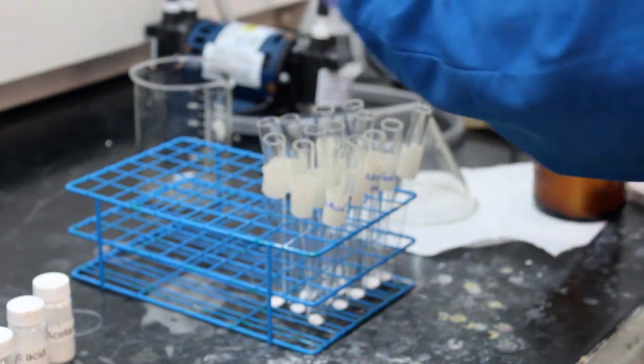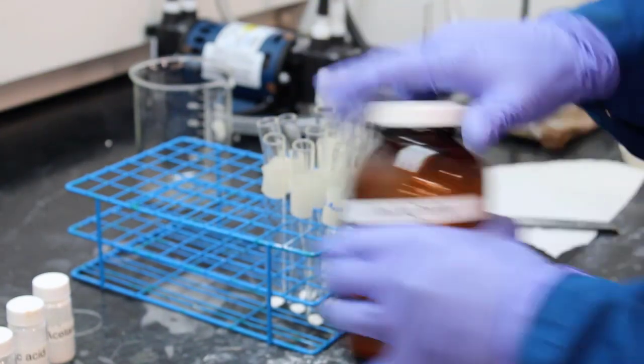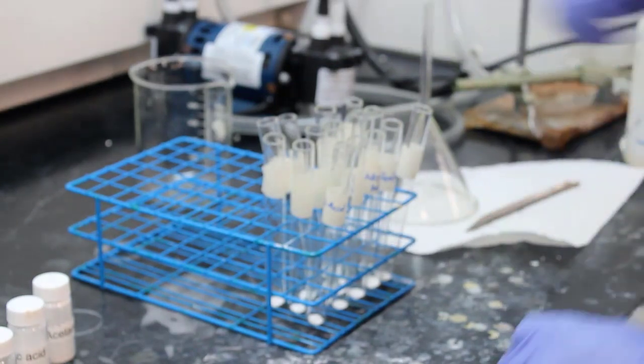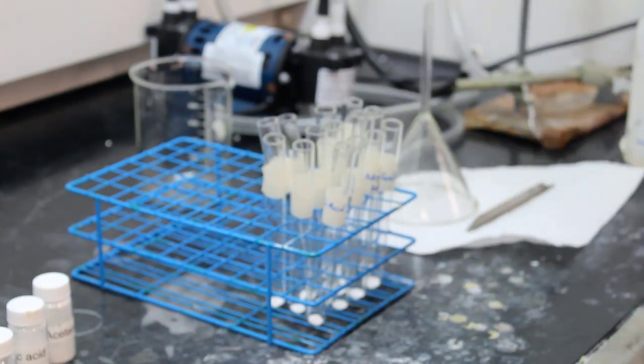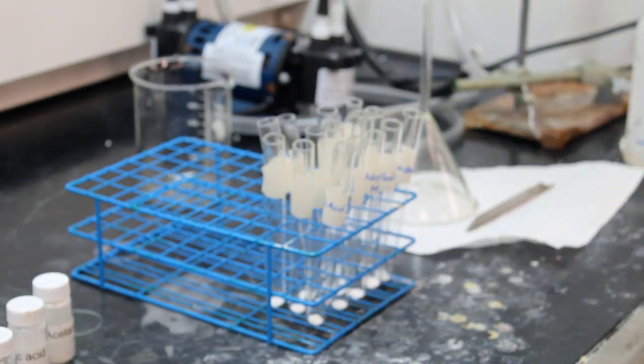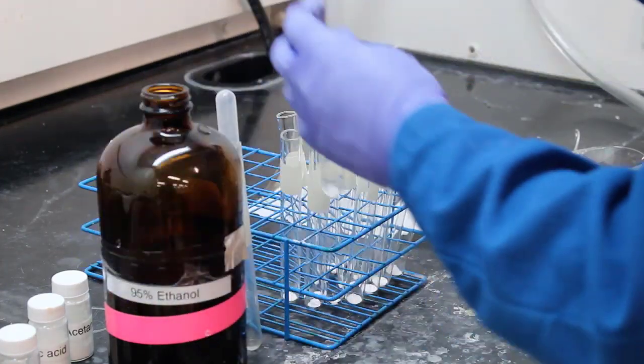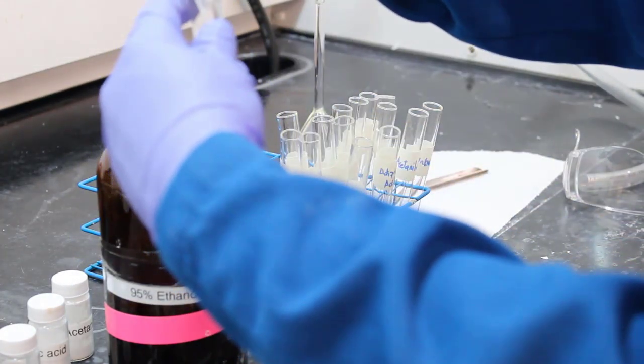All right, and then this last compound appears to be the unknown. Oh, that's a new one to me. I'm so special. I was saying it wrong. It was unknown. Yeah. Okay.